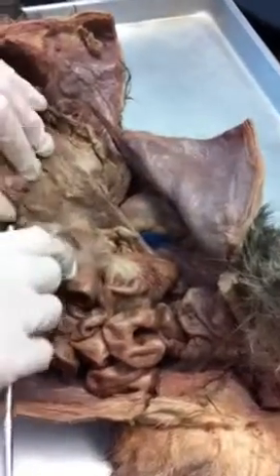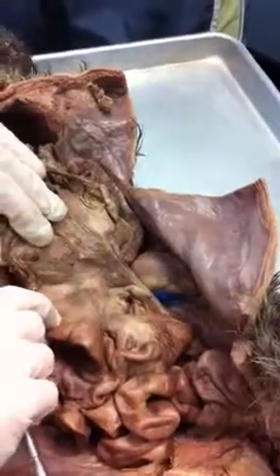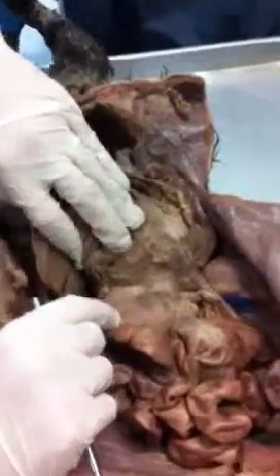Function of the pancreas? Have a bunch of those pancreatic juices, all those enzymes that come in and digest your food for you in the small intestines. All right, so what's this organ here? Pancreas. The pancreas. Excellent. What's this part here? Small intestines. What part? Duodenum of the small intestines. Then I come down, and what are all these intestines called here? Jejunum of the small intestines.